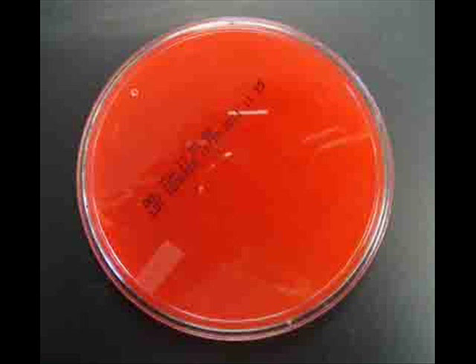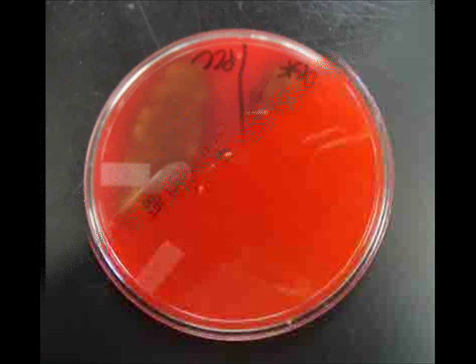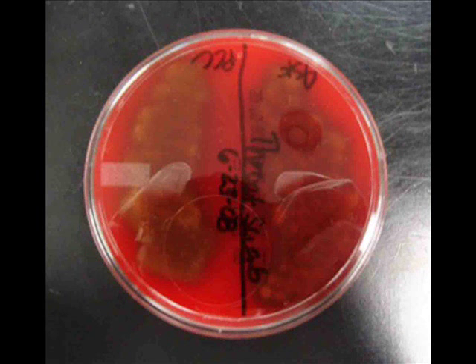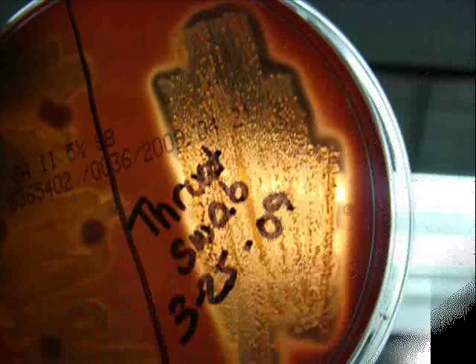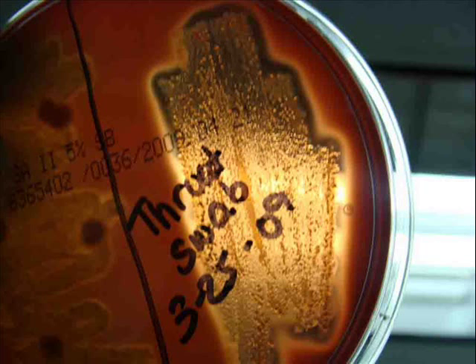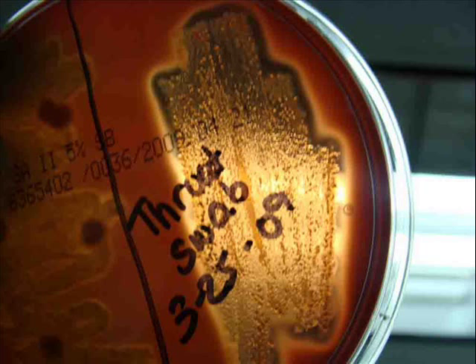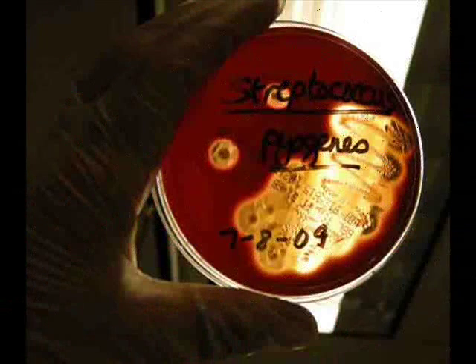To review: gamma hemolysis, which is no color change in the medium when there is growth, and alpha hemolysis, which looks like bruising, both indicate the presence of normal flora — these are normal results. Beta hemolysis occurs when the bacteria growing on blood agar have completely broken down the red blood cells, making a clear or transparent area in the medium where the bacteria are growing.